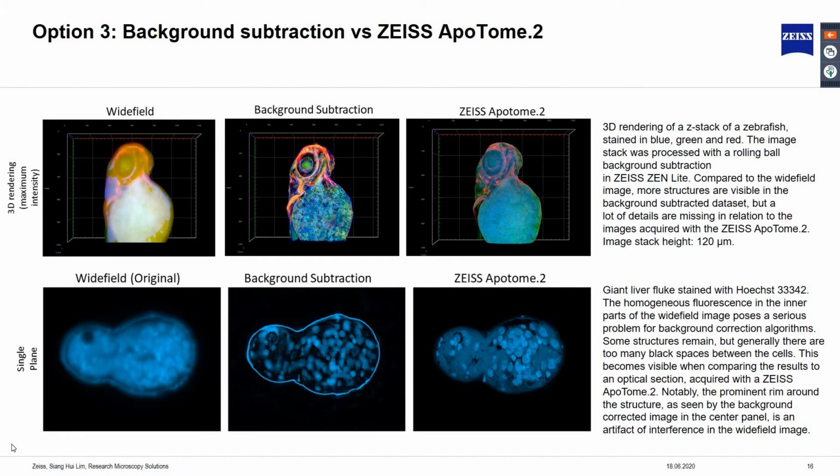Another thing to note is the prominent rim around the structures in the background corrected image. This is an artifact from interference in the Widefield image, which is not visible in apotome image. From this slide, we can certainly say that background subtraction will result in loss of information and may introduce artifact to the processed image. This reduces the suitability of background subtraction as it may lead to inaccurate scientific conclusions.